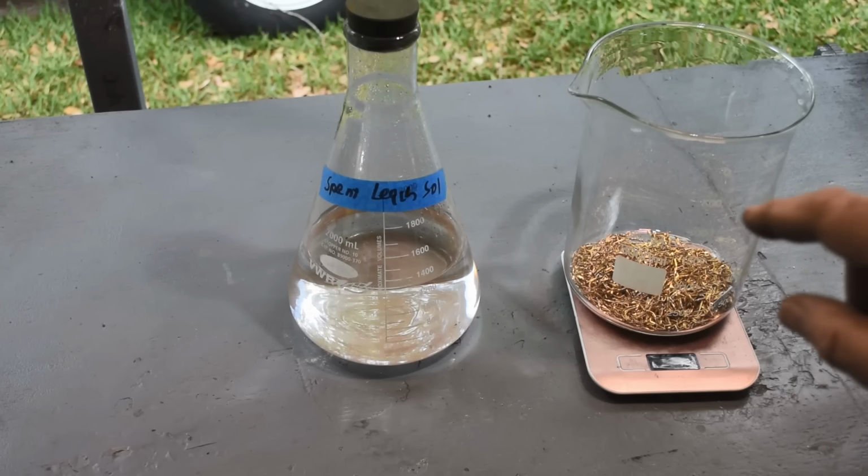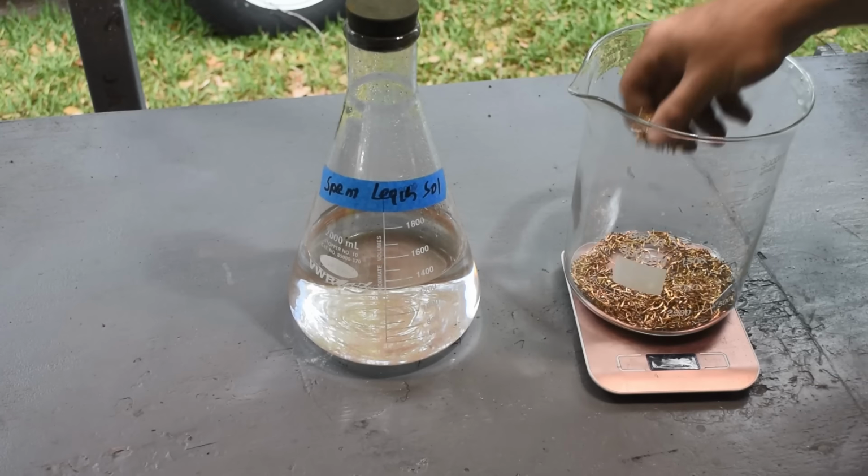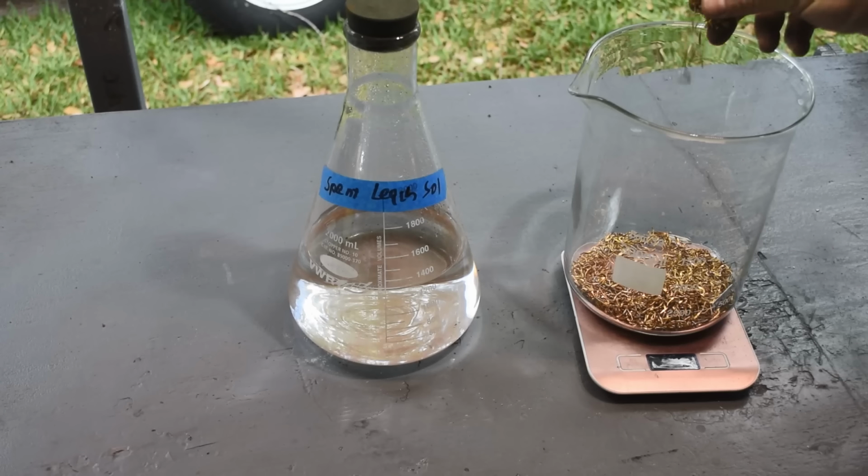And then if it looks like there's still a significant amount of gold on the pins, we'll do a third one. I think that multiple treatments are probably the way to get the gold out of this. It seems to me like if I leave the leach on this stuff for too long, it stops going after the gold and starts going after the tin and copper, okay?